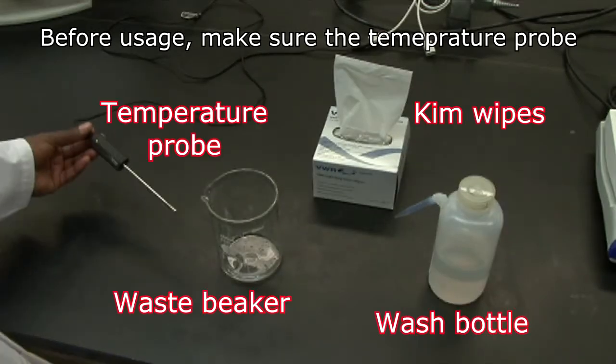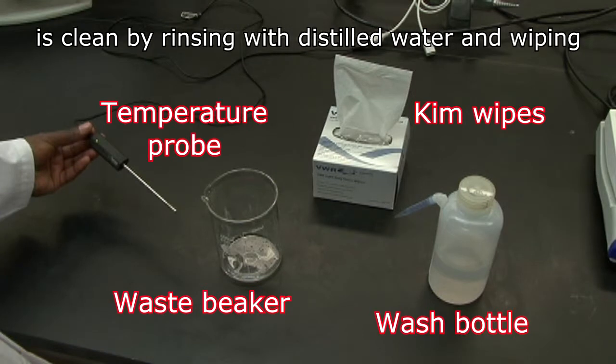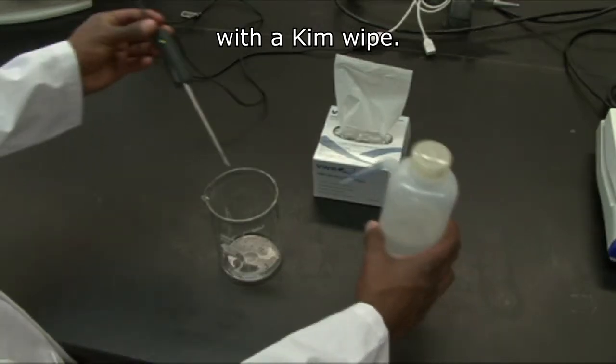Before usage, make sure the temperature probe is clean by rinsing with distilled water and wiping with a Kimwipe.